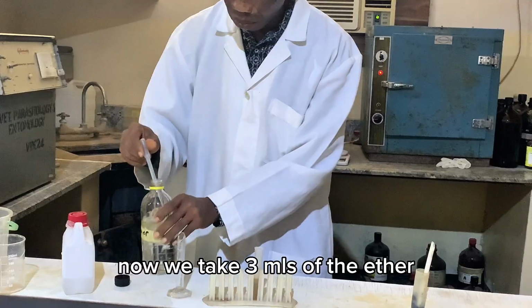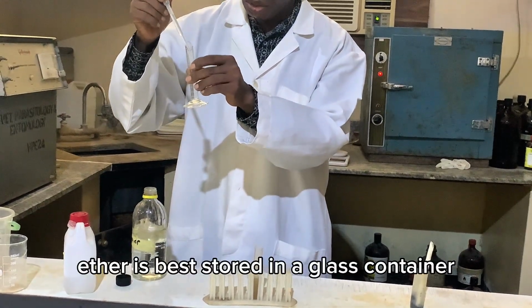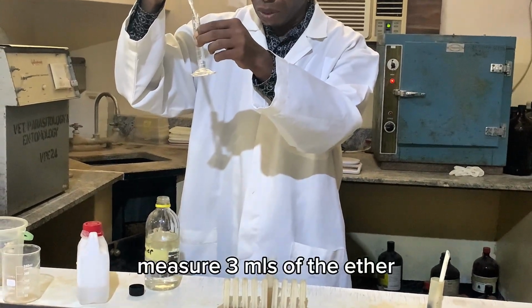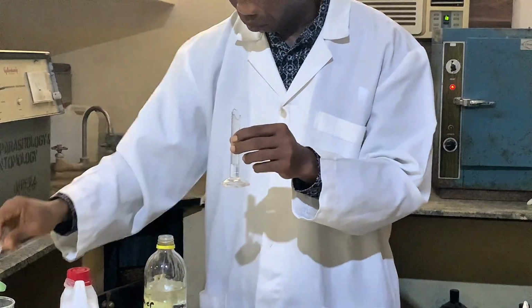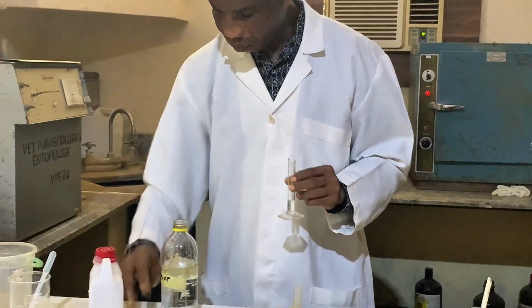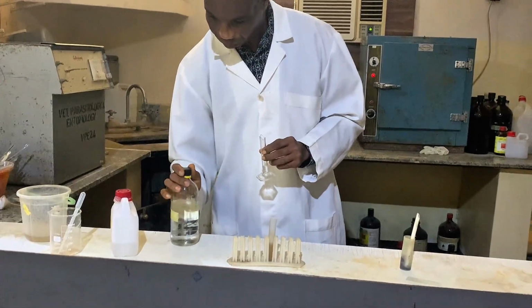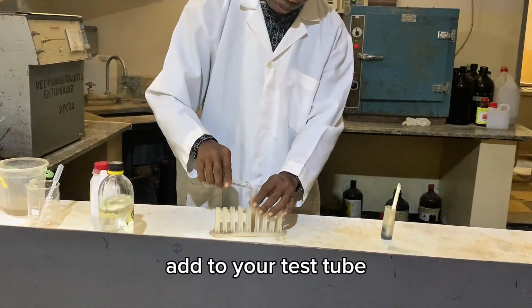Now we take 3 mils of the ether. Ether is best stored in a glass container. Measure 3 mils of the ether. This is 3 mils. Add to your test tube.